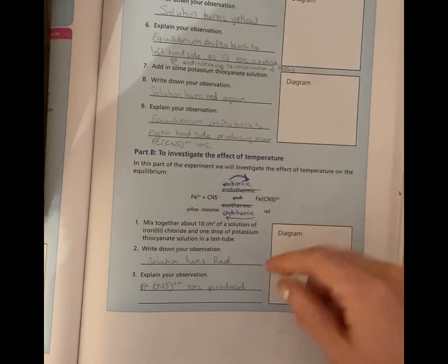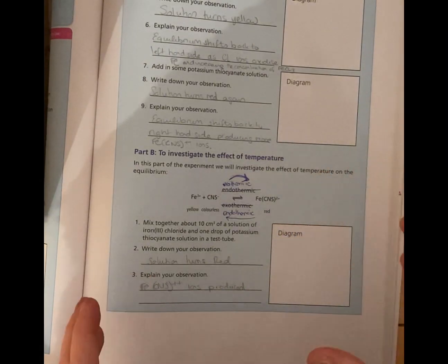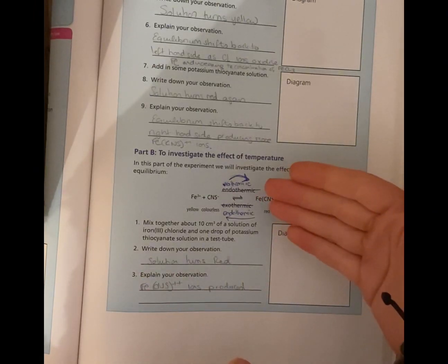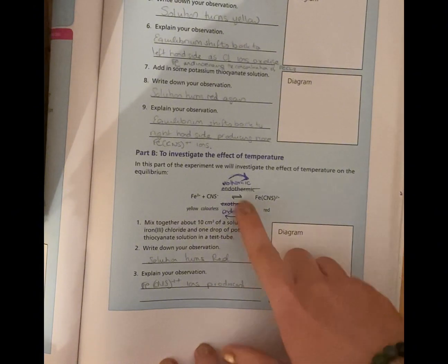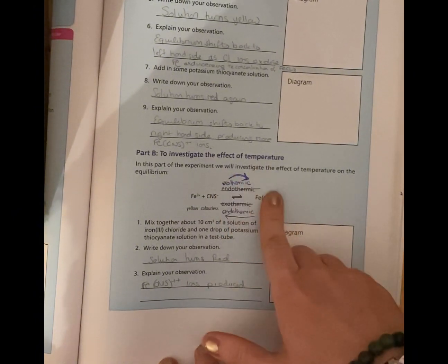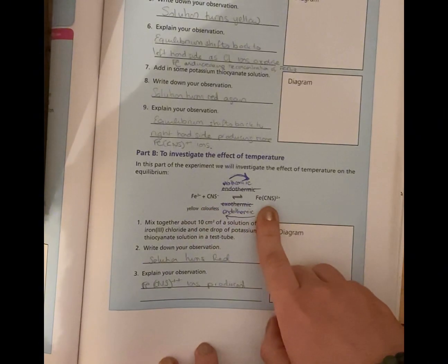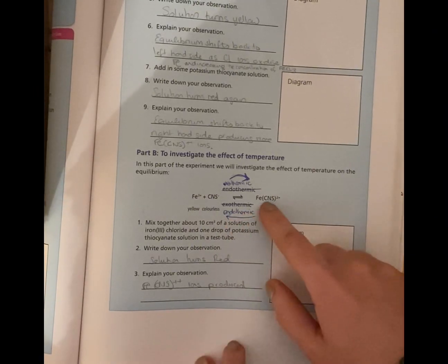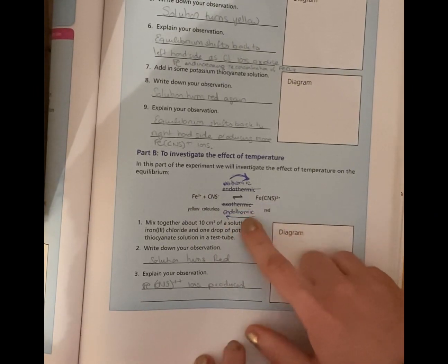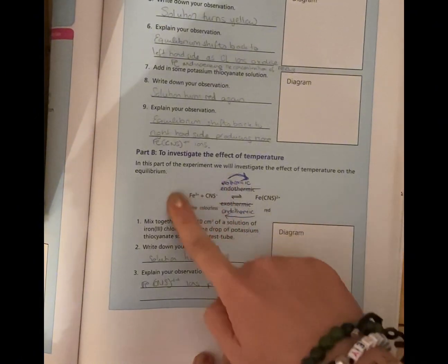When we add the test tube into the hot water, that's increasing a stress on the system by making it hotter. So the system is going to react in the opposite way, which is the endothermic reaction. Just a little typo here, this is exothermic going this way, this is endothermic. So we're going to be taking in that extra heat, and that means we're going to look at the endothermic reaction, which takes in heat. If we're going this way, it's going to produce more of a yellow colourless solution.